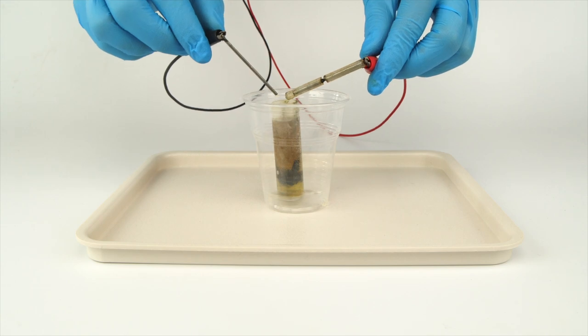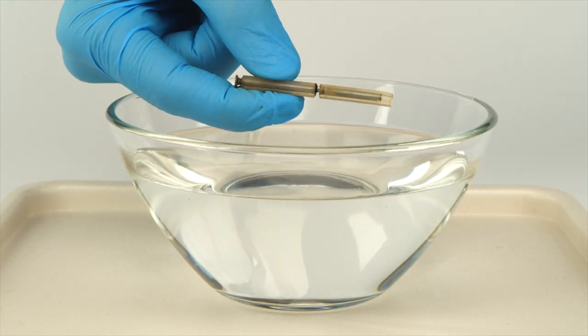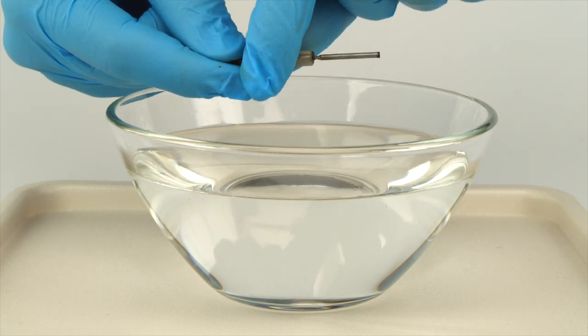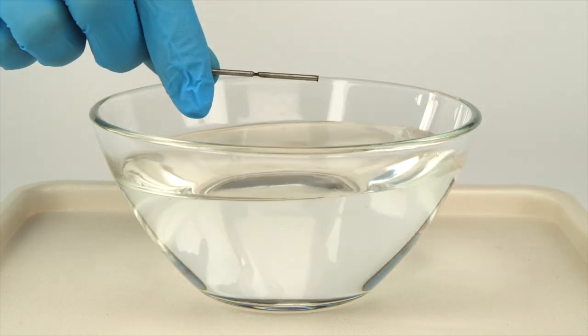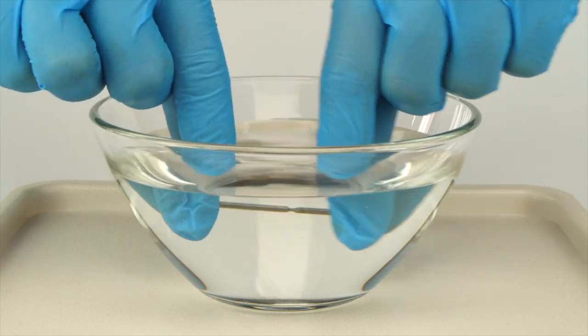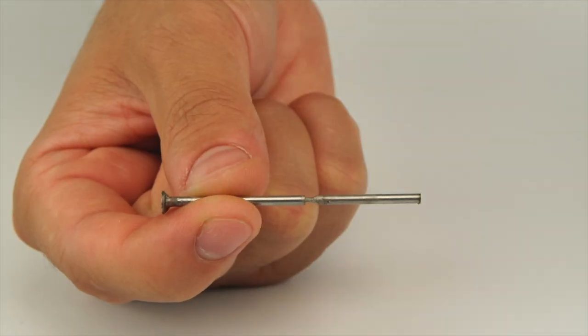Retrieve the nails after 45 minutes. Remove the tubes from the first nail and clean it with water. Now try to break it.